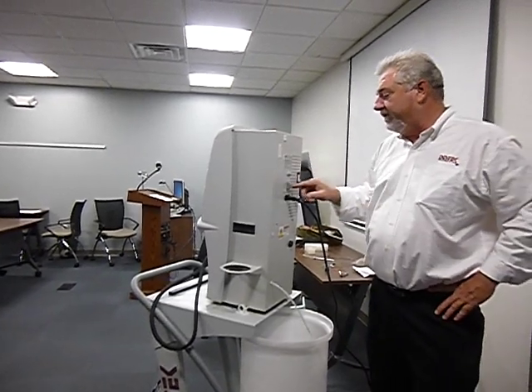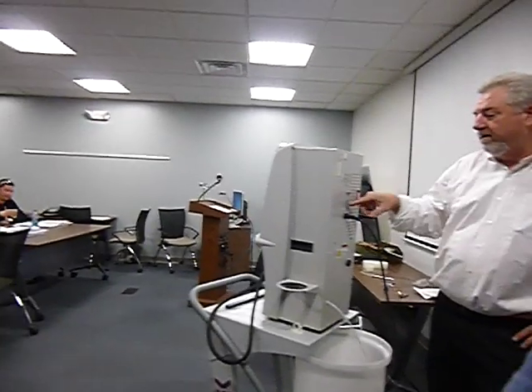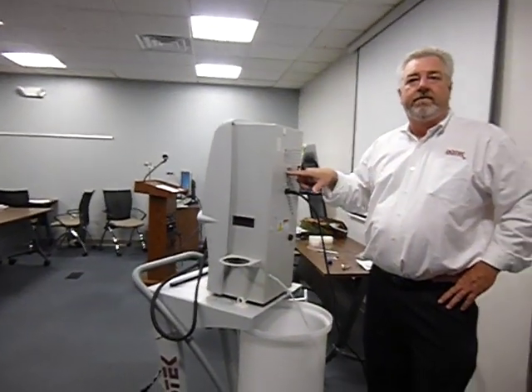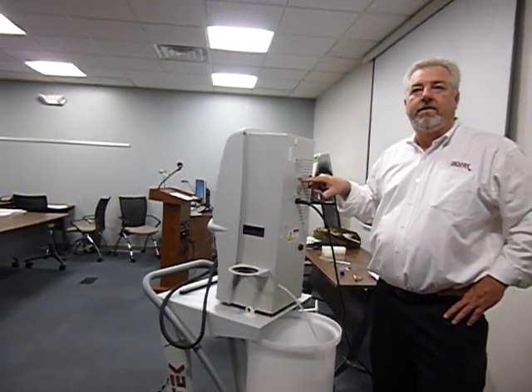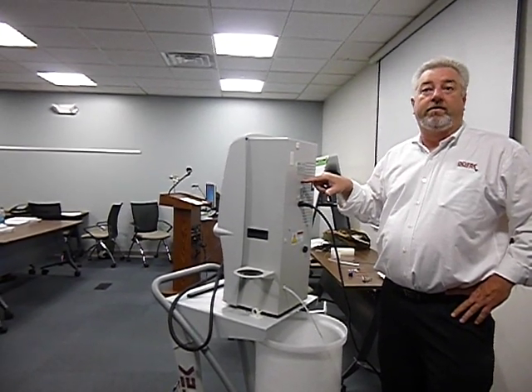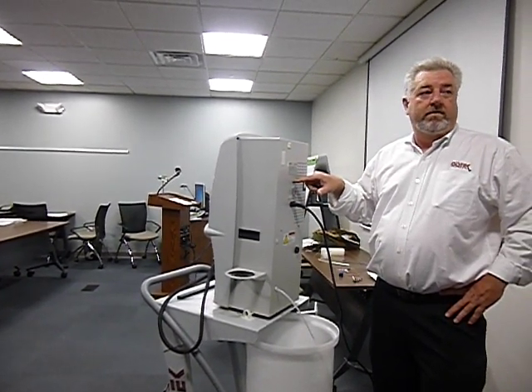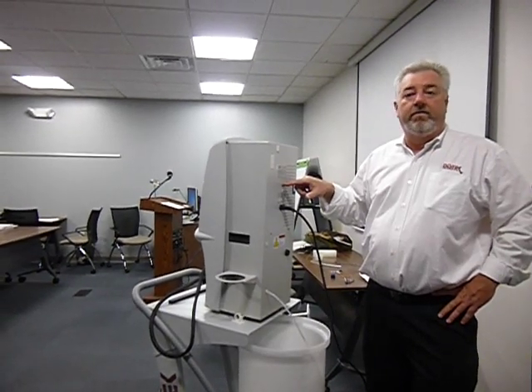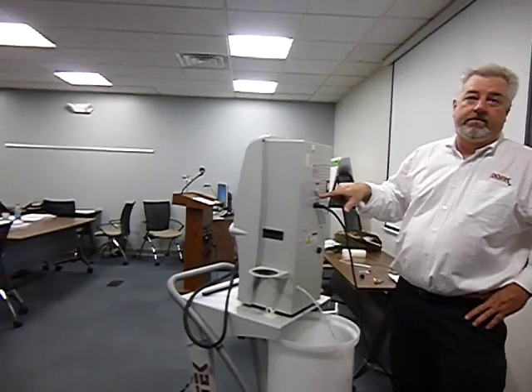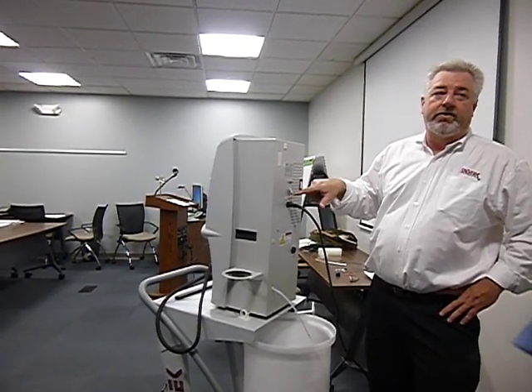You have two connectors in here. The 232, what do you think the 232 is for? For firmware upgrade? No. That's for the hyper-terminal. To upgrade the firmware, you need a certain program, and you need this port. And you should have it on your laptop.